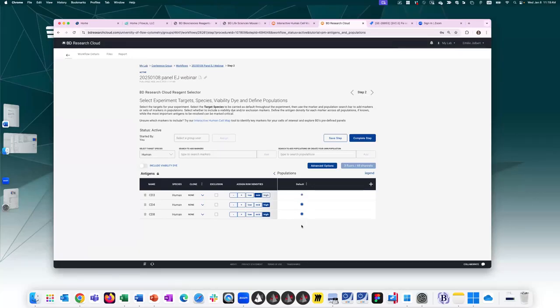However, it doesn't represent when I gate. I'll be gating on specific populations of interest. I won't be gating on all T cells at once. I'll be looking at just CD4 T cells and just CD8 T cells. So in that case, I won't be getting co-expression of CD4 and CD8. So in that case, I might want to generate more than one population of interest. So by pressing this little plus button, I can add additional populations.